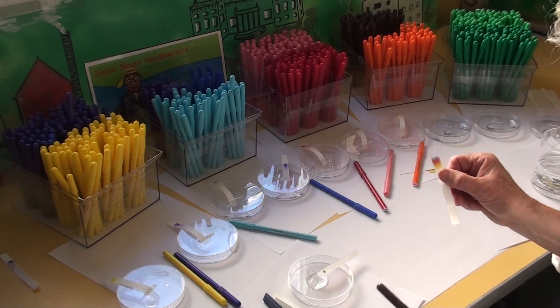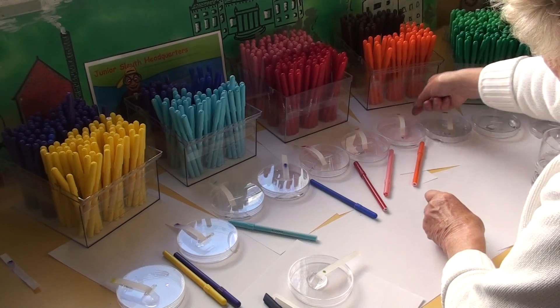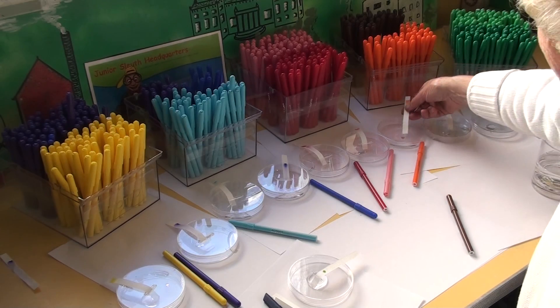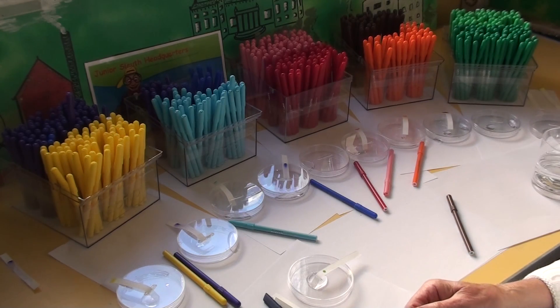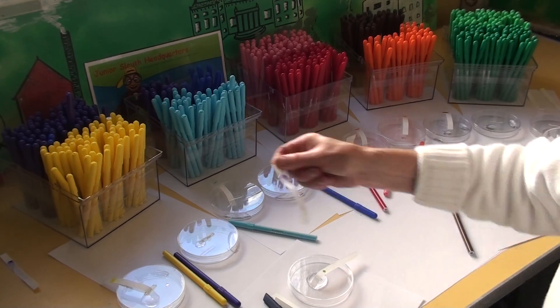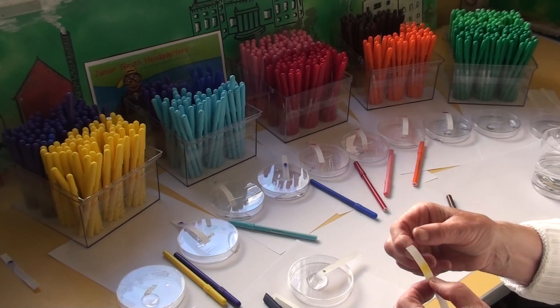As the water climbs through, it makes it smudgy, and sometimes — nearly always — it separates the colours in the pen. This is a chromatogram I did with the brown pen, and look — it's got blue, red, and yellow in it. Here's one I did with the orange pen: orange, as we saw earlier, is made of yellow and red, so the orange divides into yellow and red. This dark red pen divided into pink and an orangey-red — it's intriguing really. The purple divided into a sort of red and blue, just as it ought to have done.